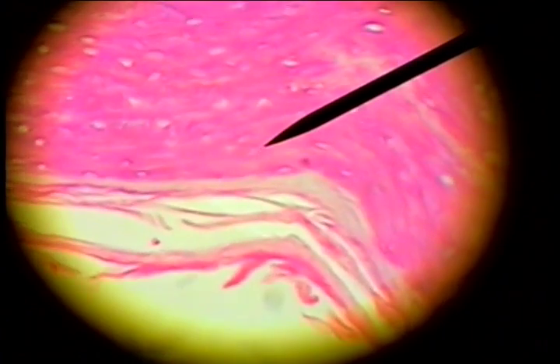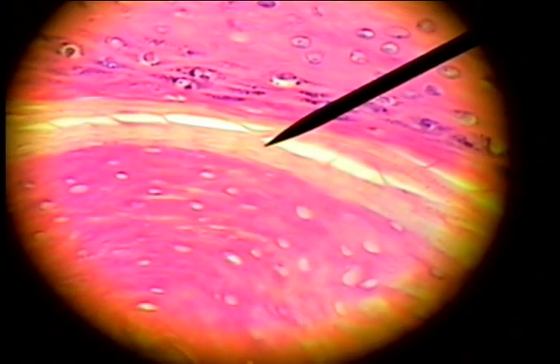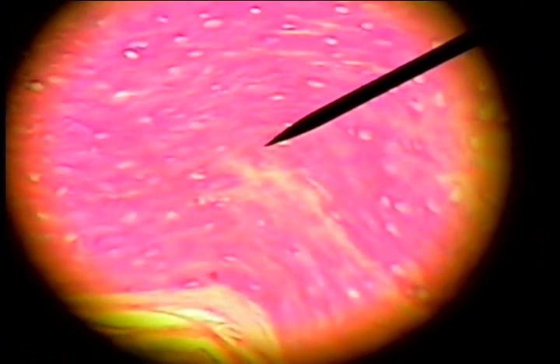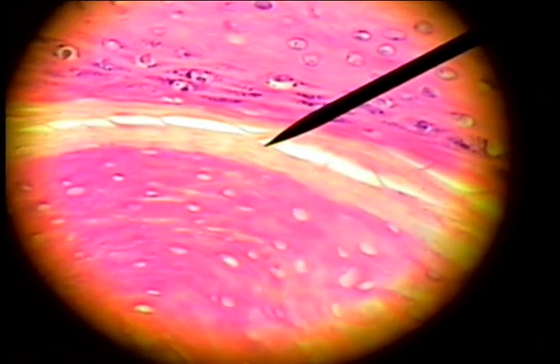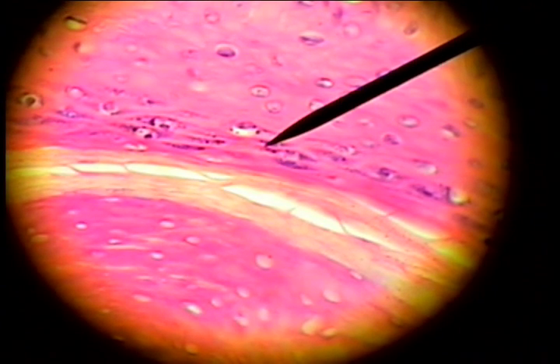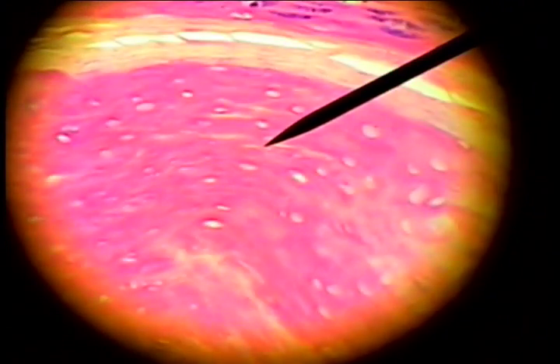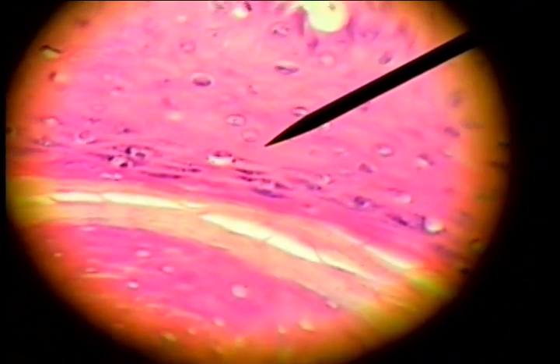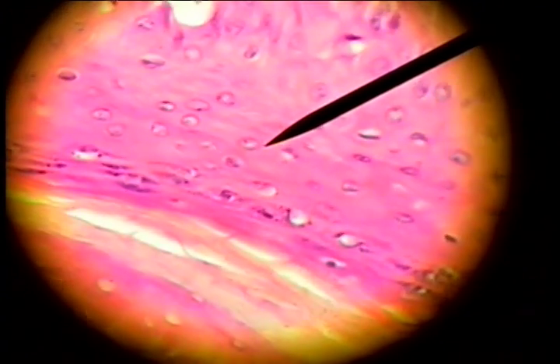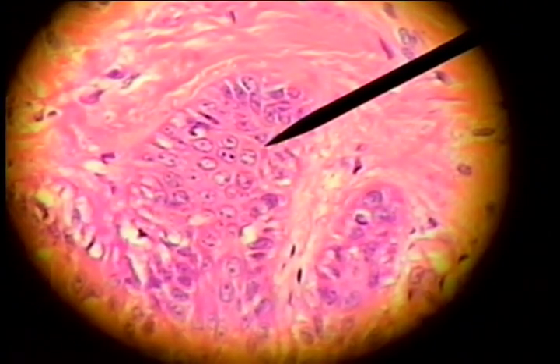There is a thick keratin layer, which is essentially composed of dead cells and the protein keratin — this would be the stratum corneum. Then the thin light layer is the stratum lucidum. Then the layer where cells have keratin granules as they prepare the protein for the stratum corneum is the stratum granulosum. Beneath that is the stratum spinosum.